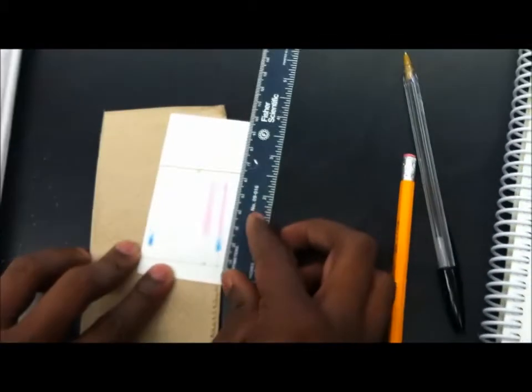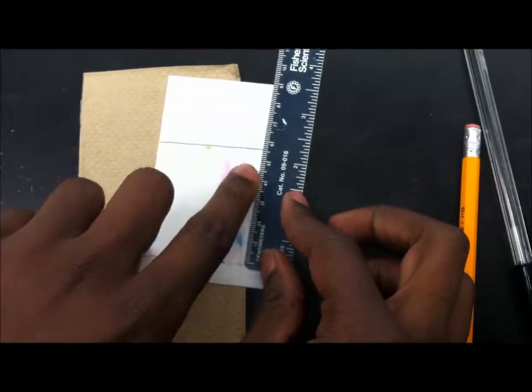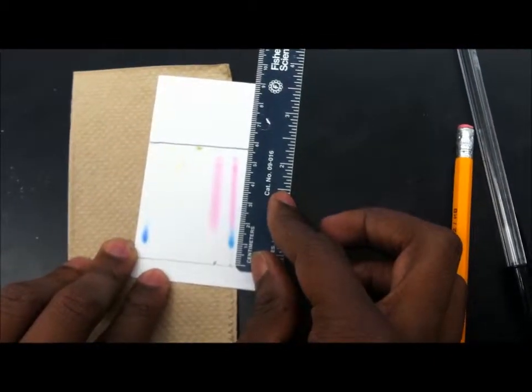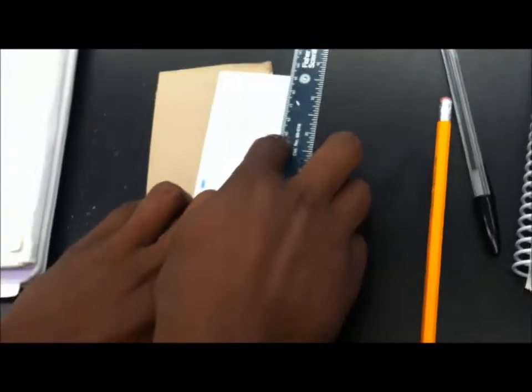And now we have our unknowns. So now we're going to measure our unknowns with the ruler. We're going to start from the line and you'll notice that the strongest point is up in this general area. So we're going to mark it as about 5.8 as well. And there we go. We documented this and we're going to continue with the experiment.